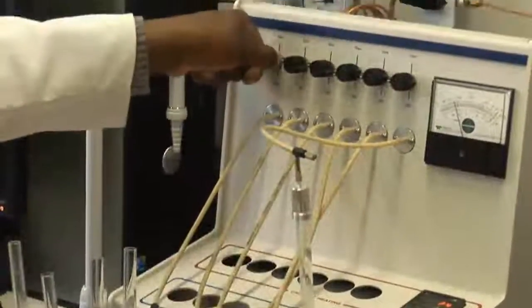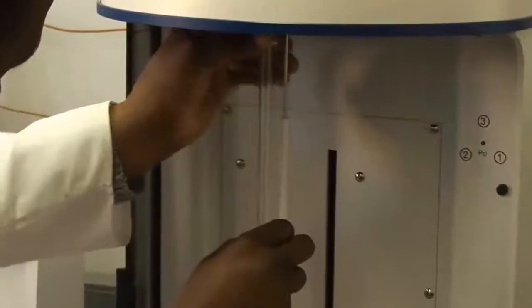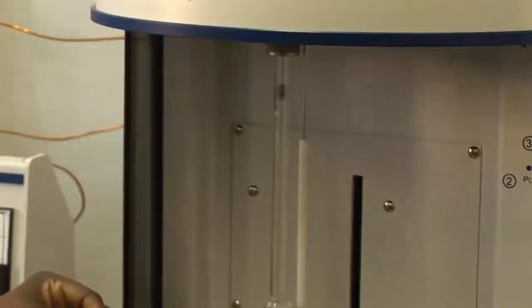As soon as we've prepared nanostructured materials, we do something that we call characterization. This is to get to know all the properties that are embedded in such materials. This is a TriStar machine. It allows us to measure the surface area and the porosity of different materials that we produce. This is particularly useful for the reactivity of nanomaterials. The larger the surface area, the better the material.